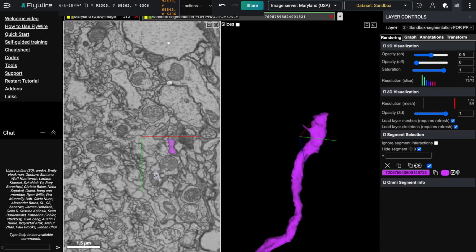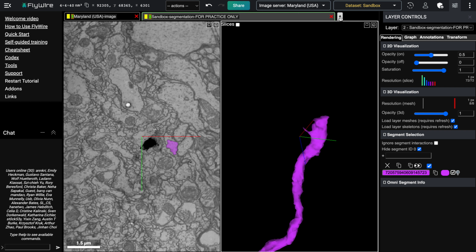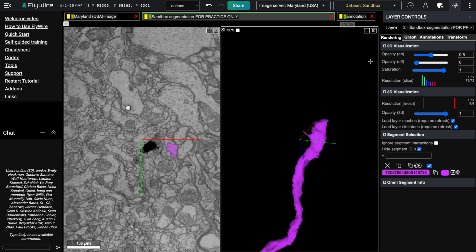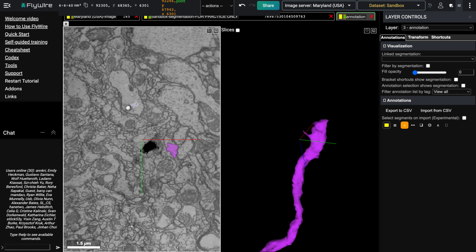You want to get pretty close to the point where the neuron breaks, but you want to make sure that you still have the neuron in your visual field when you're looking for something else close to it. So to me, this object looks pretty distinct. What I'm going to do is add an annotation layer, right click to select it, and then select an annotation point and place that right here.